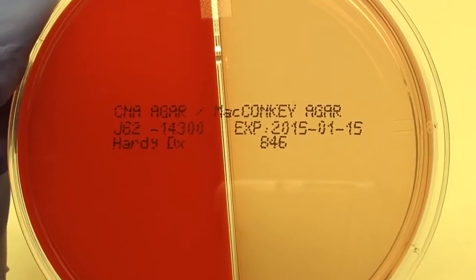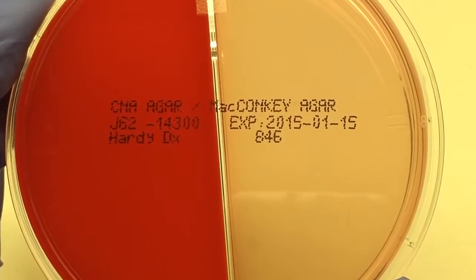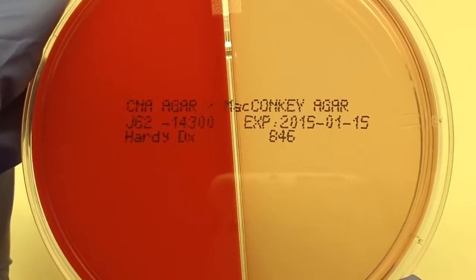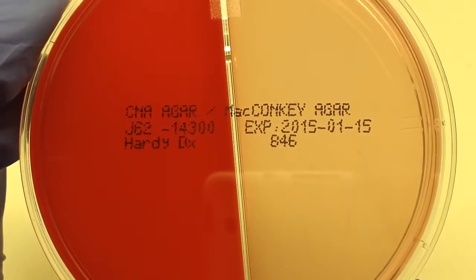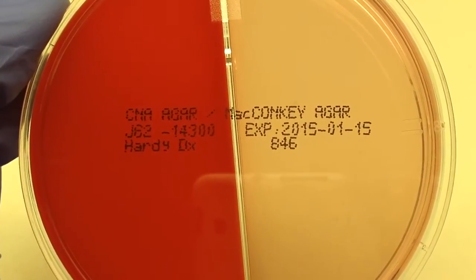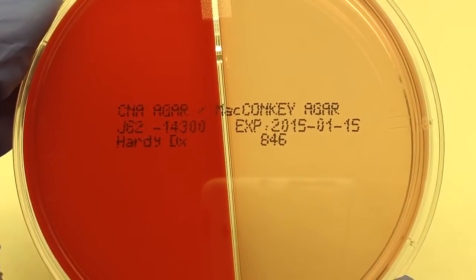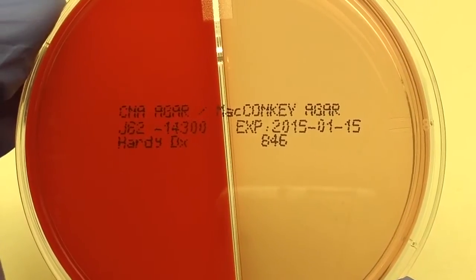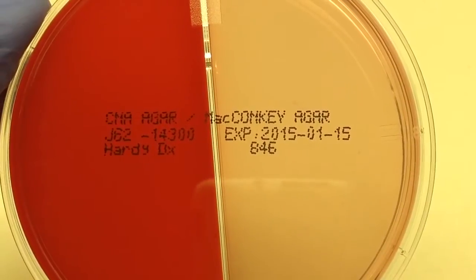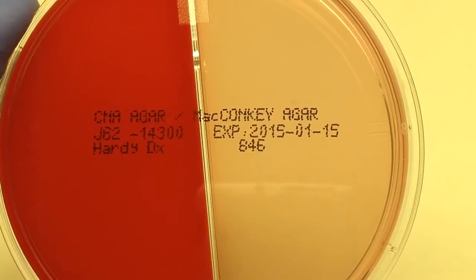Now when I say gram-negative, I don't mean fastidious gram-negatives like Haemophilus or Neisseria. This agar is rather for looking at members of Enterobacteriaceae. The CNA would be considered a differential and selective agar — differential because you can read hemolysis on it. The MacConkey's is also selective and differential. It's differential because the MacConkey's contains lactose, and organisms that are lactose positive and lactose negative can be differentiated on that plate.